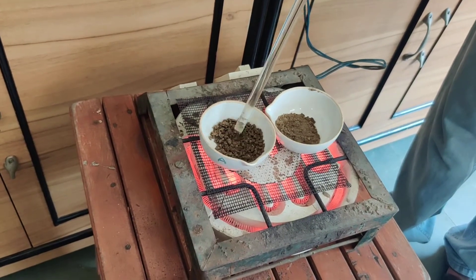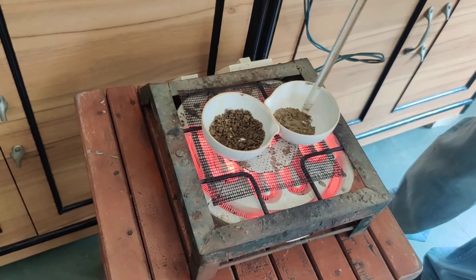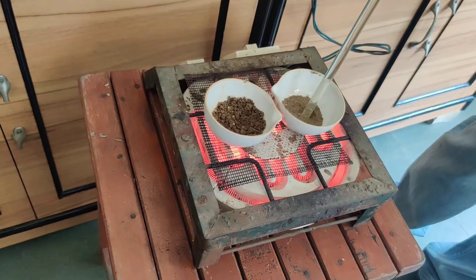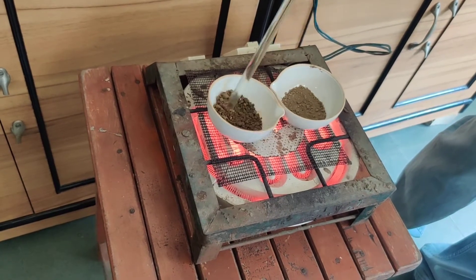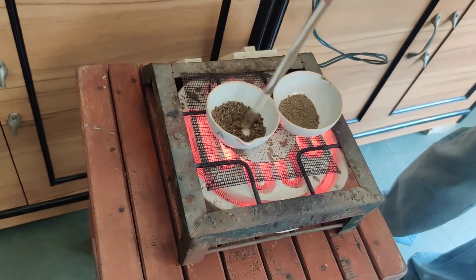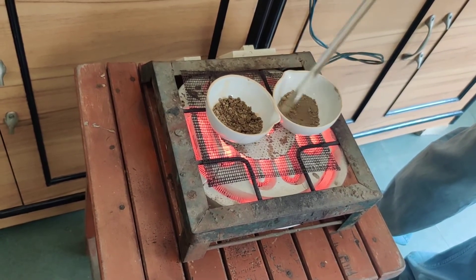If big lumps are there, you will break them — big lumps of the soil — because they may have moisture content. Soil is becoming dry. Now it is totally dry, this particular sample, and this one also begins to dry. It is taking some time, which means it has more moisture. Now it begins to dry and is almost dry.